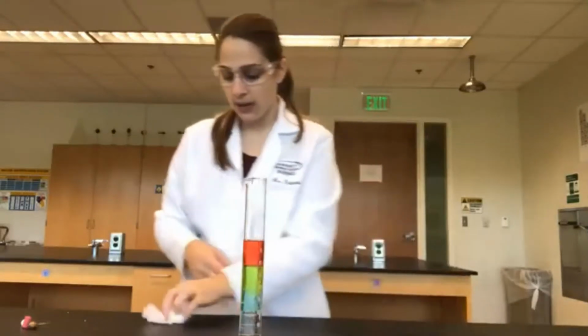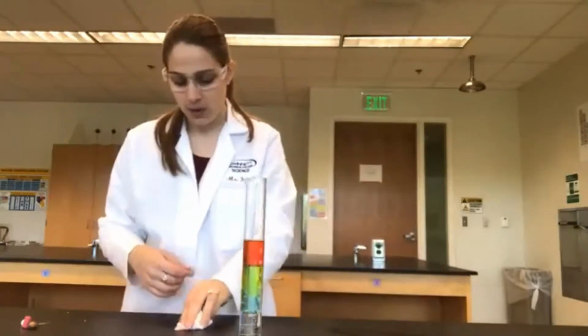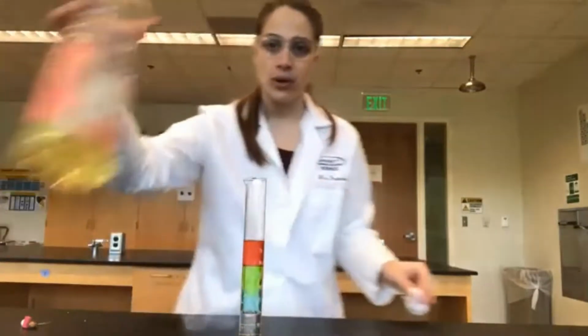And then for our last household item, we're going to add some vegetable oil.